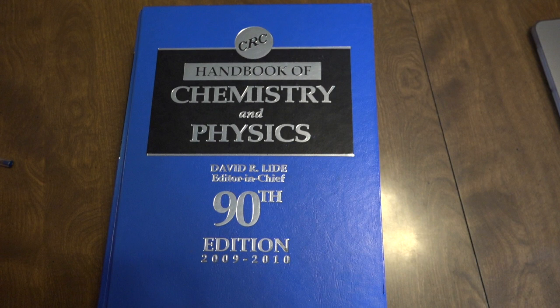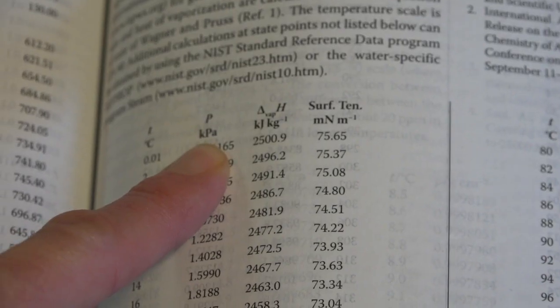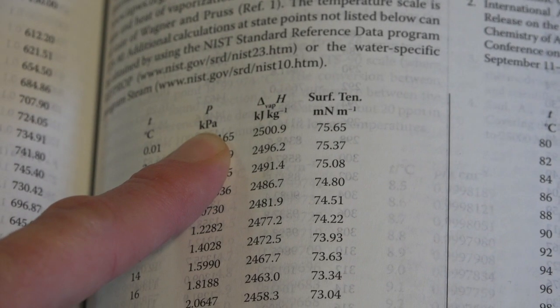In this experiment, the water makes our gas wet, and so we have to consider what is called the vapor pressure of the gas. It is based upon the temperature of water. So we're going to look inside this book that has all kinds of chemical data, and you can see we have a number between 20 and 22. So we'll just round up to the 22 and use 2.6453. Notice it's in kilopascals.